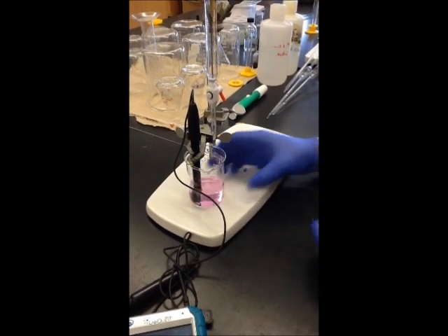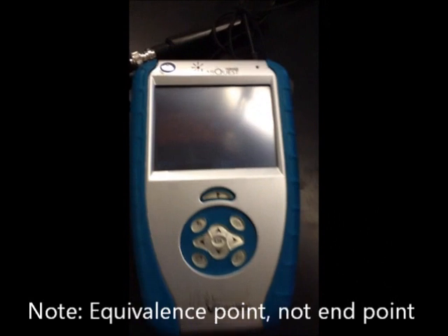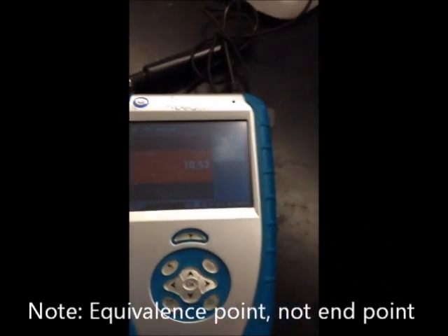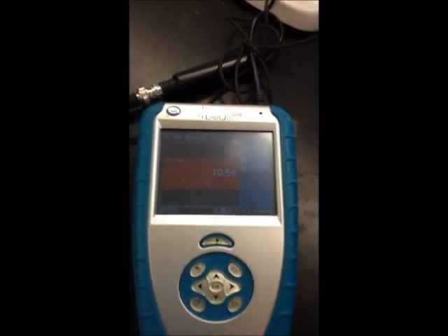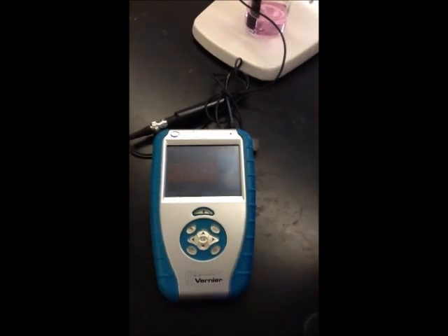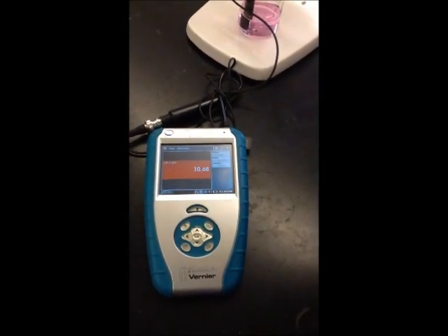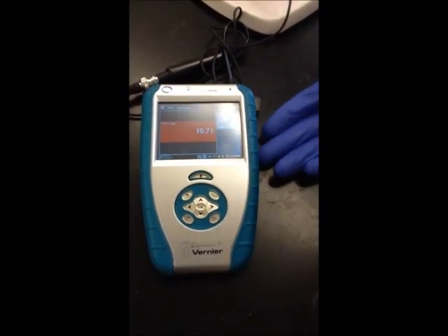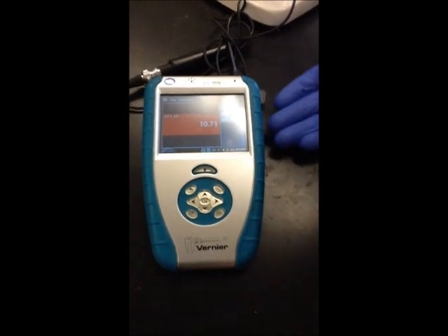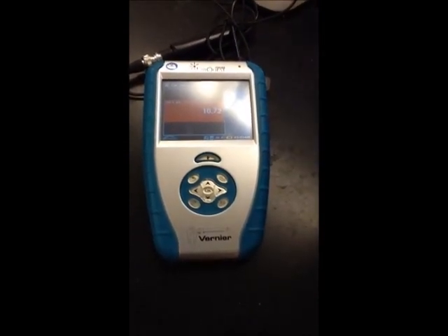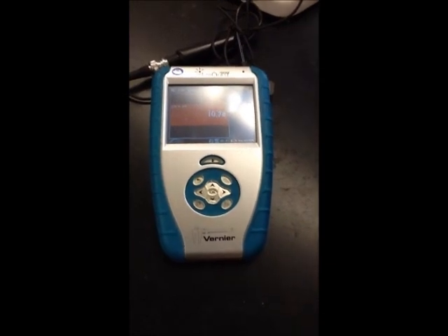It's pretty clear. There's our endpoint. Stirring does not make it go away. Oh yeah, the pH is also clearly indicating that we've reached the equivalence point. It's now an actually basic solution, which is corroborated by the purple color.